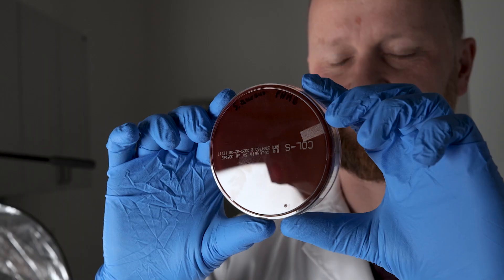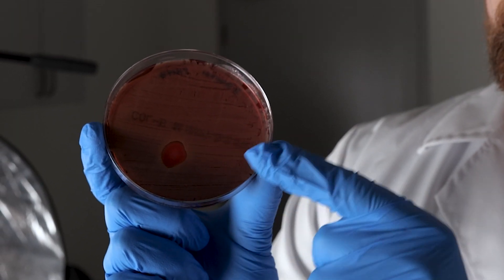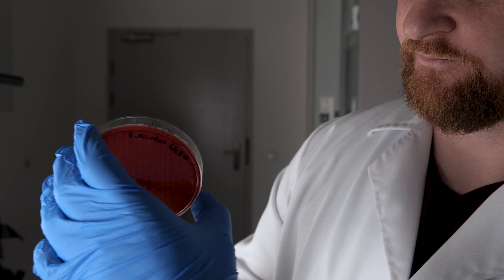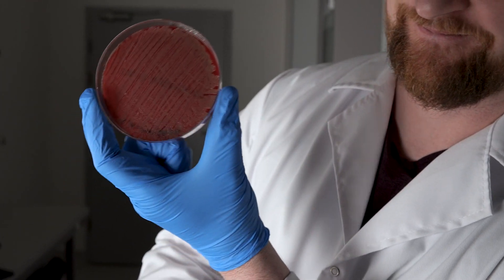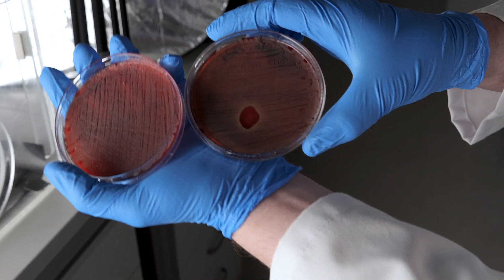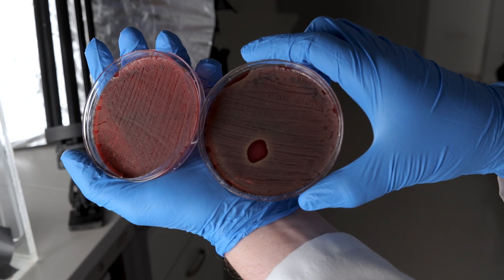We encourage you to replicate this simple experiment in your own laboratory. You need only an agar plate, bacteria, and antiseptic. As we have shown in our research papers, low-concentrated hypochlorites may be effective in physically rinsing bacteria off, but not in killing them. Stay tuned and be prepared for more experiments.